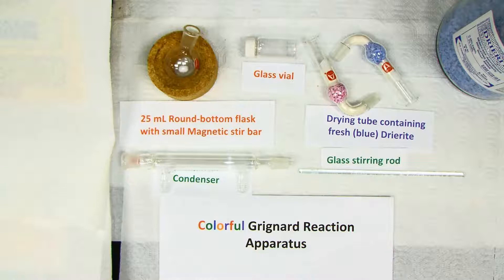This may make you guess that a big difference between this experiment and others you've done is that the glassware must be totally dry, not just dry enough to not see drops. Any water present, unfortunately, will cause the reaction to fail. So for this experiment, we will oven dry our reaction glassware.